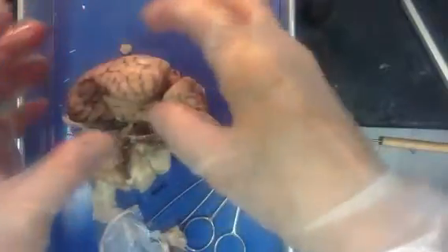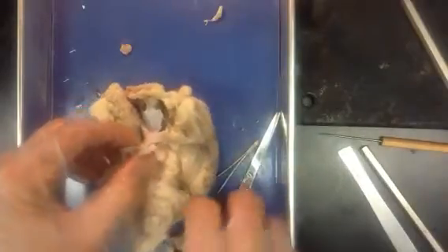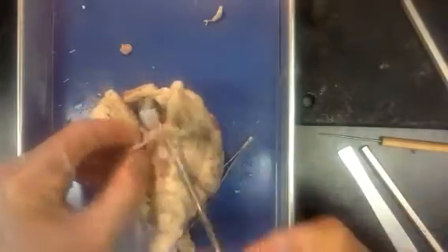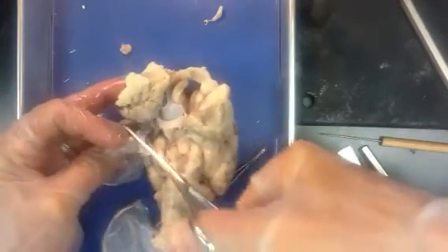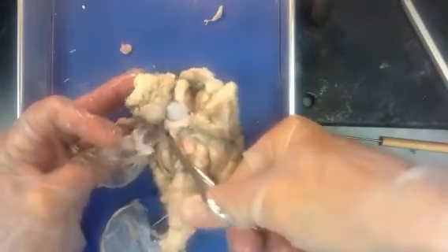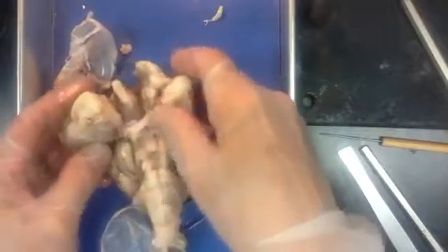It's the medulla because it's in the middle, and the cortex grows down around it, covering it. Many other structures in the body have a medulla and a cortex: kidneys, lymph glands, adrenal glands. This is the first time in A&P 1 that we've really talked about a cortex and a medulla. It's not quite as accurate in terms of being in the middle and then surrounded by a layer, but you kind of see it.